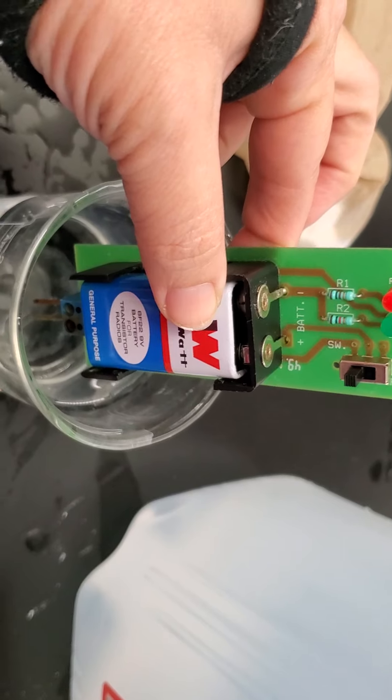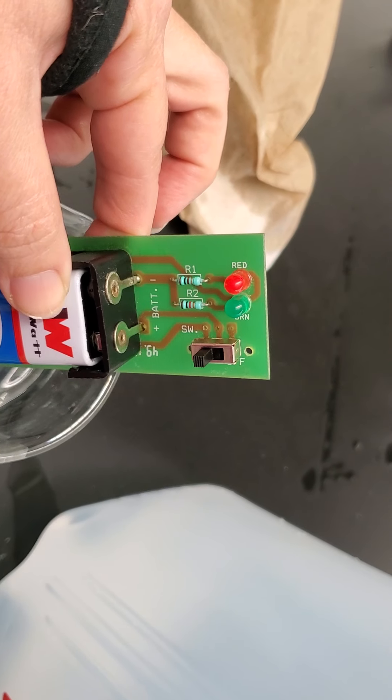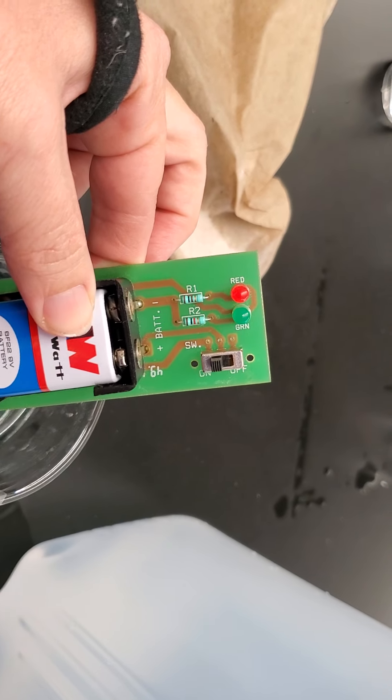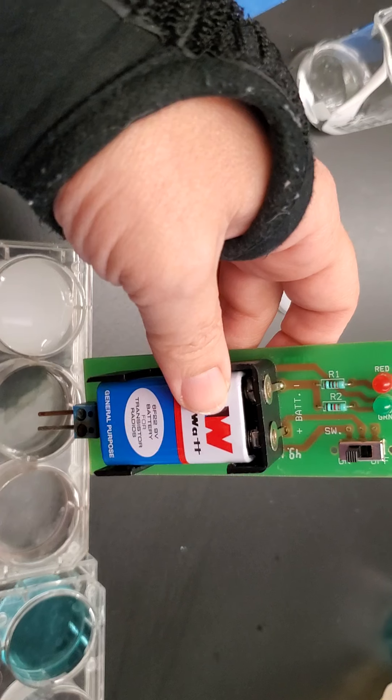I want to show you how I'm cleaning it. Each time I'm dipping it in pure water—you can see there's no lights coming on in the pure water—and then I'm wiping it off in my paper towel every time I use it.